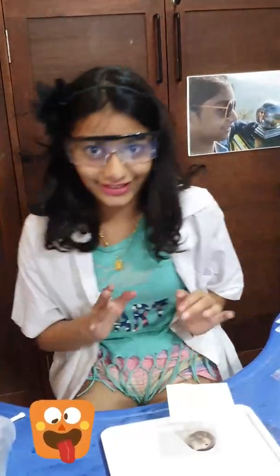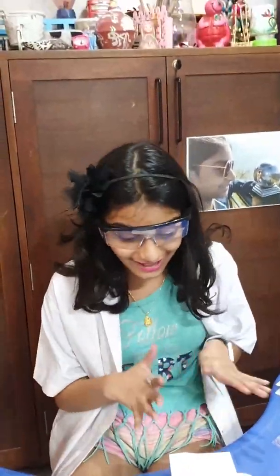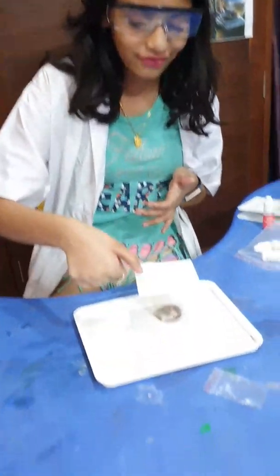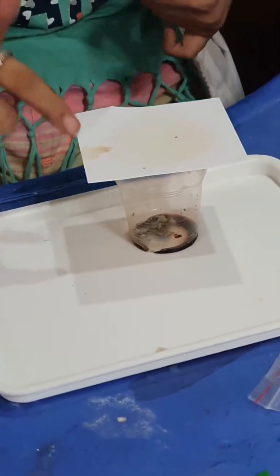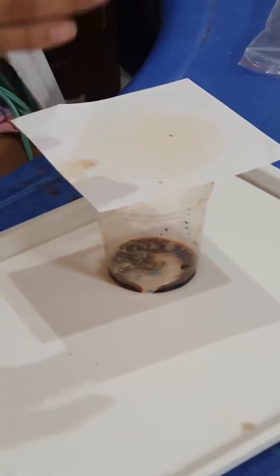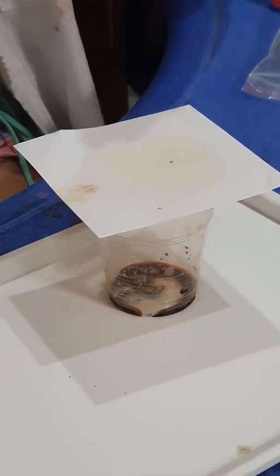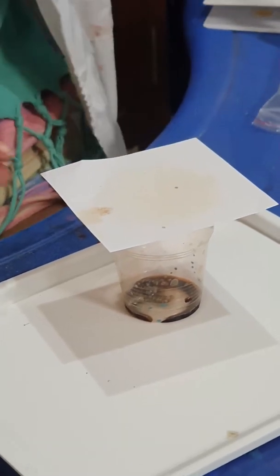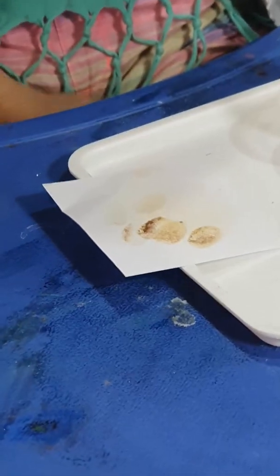I'm really, really excited to see how my fingerprints have turned out. If you can see, I had touched the paper and put it like this, so my fingerprints are here. I'm really excited to see what the fingerprints will look like below. Let's see — wow, nice!